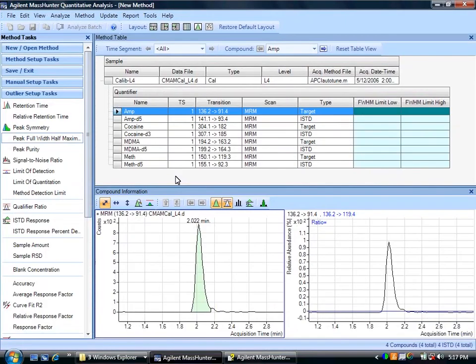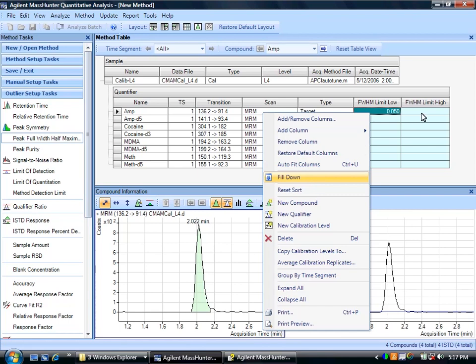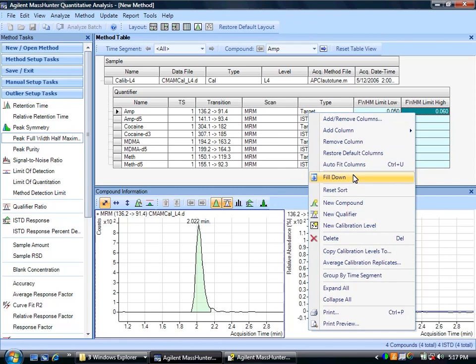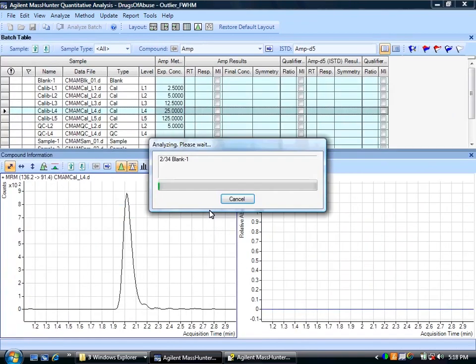In the quant method editor and under the outliers section, I'm looking at peak full width at half height maximum. I need to put some limits in here, so I will put a limit of 0.05, and then I'll just use the fill down. And over here I'll put 0.06, and again I'll use the fill down. So let's go over and apply this method, and then analyze.